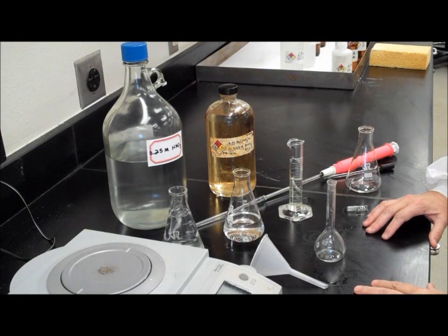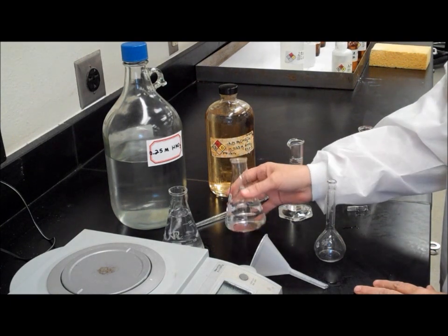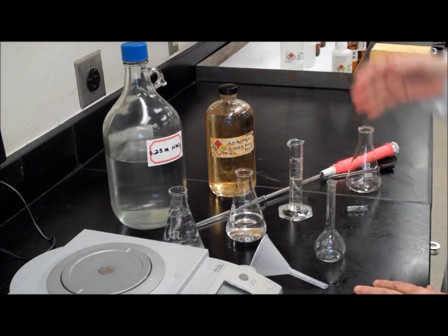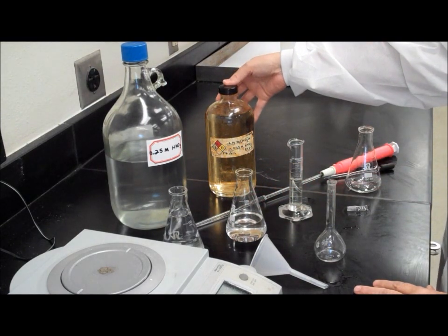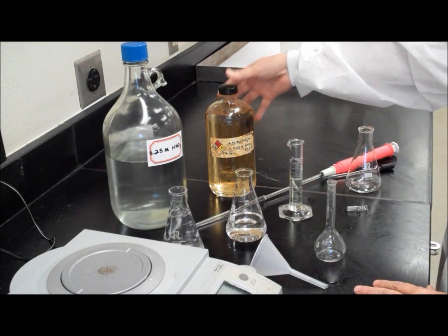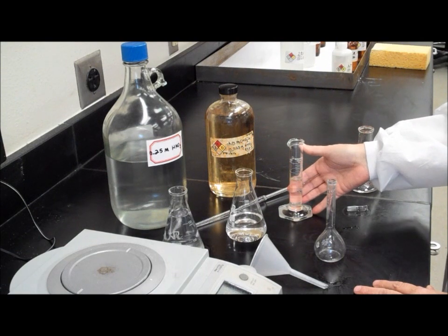In your first solution, which is your blank solution, you will not be using any of your stock solution. You will, however, be using 15 milliliters of 0.2 molar iron nitrate, which I have pipetted into this graduated cylinder.